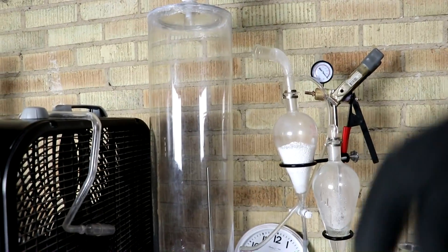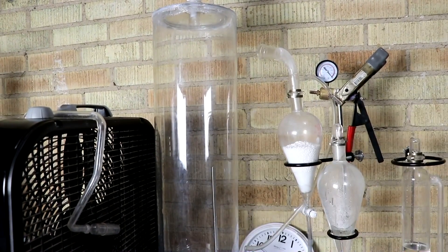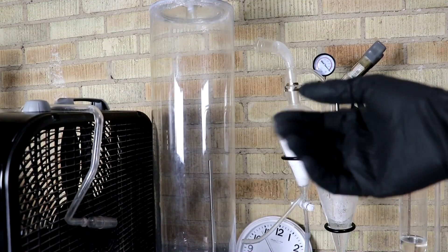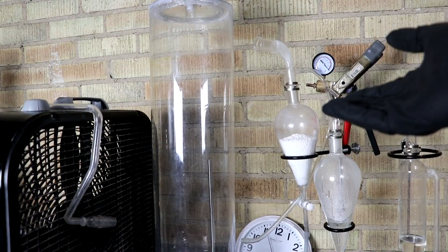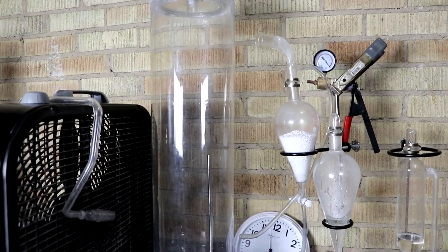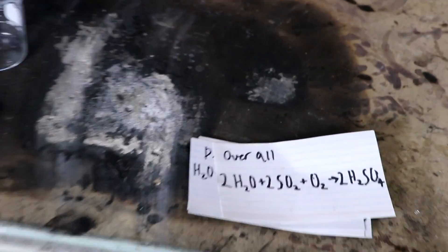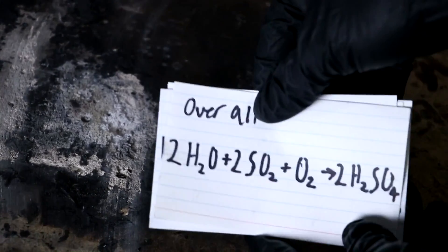Now my chamber today is this glass cylinder. Historically this would have been a lead-lined wooden box the size of a cathedral, but I'm just doing a small scale test today. I'll probably scale up at some point, but the reaction that's going on here overall looks like this.